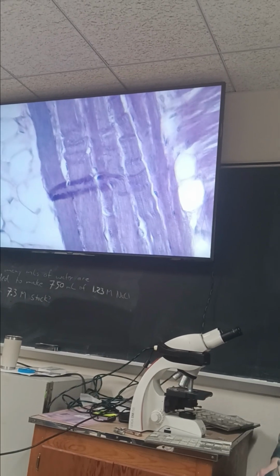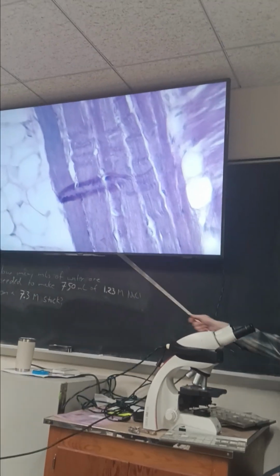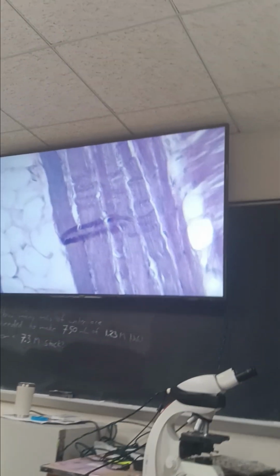What do we see? At the back of the room, it might be kind of tough, but what do you notice about this area? Does it have directionality to it? Okay, so maybe that's useful. Are these cells massive? Actually, let's just start there. How many cells are in this picture? One, two, maybe three, 4, 5, around 6, maybe 7 are in this.